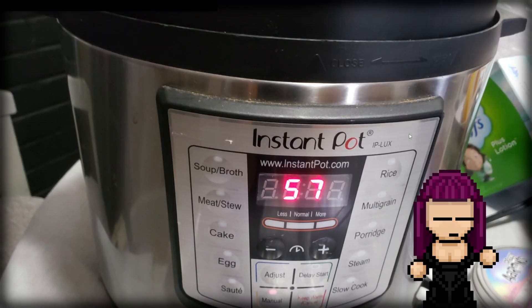I went ahead and set my instant pot to manual for 60 minutes. I don't know exactly what the temperature or pressure is, but for this instant pot, 60 minutes at its highest manual setting has worked well. The steam setting is recommended for sterilization but it only has a 10-minute max cycle. In the past I've had success setting mine to manual for 60 minutes, which is the default time, and it's been great.